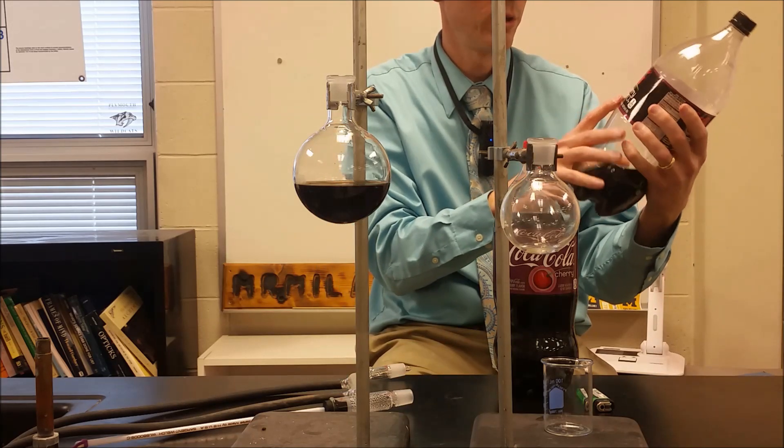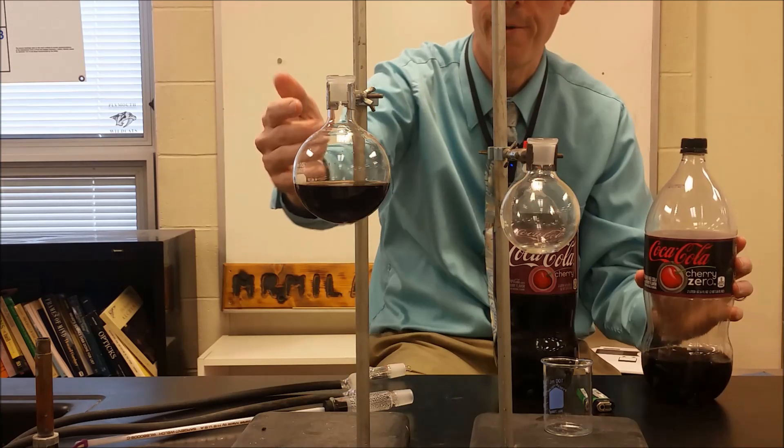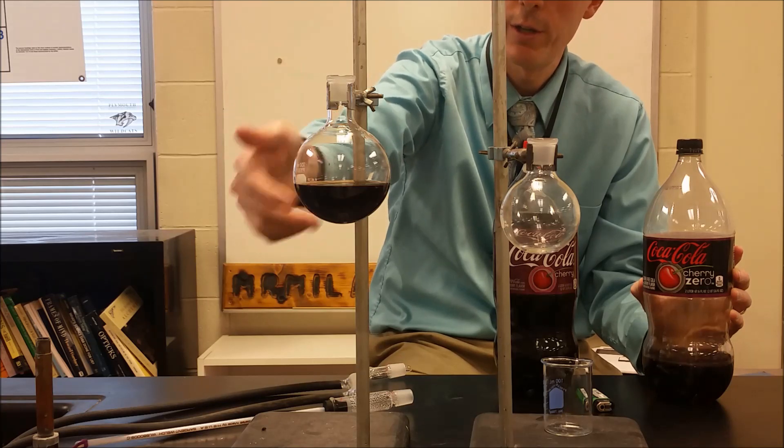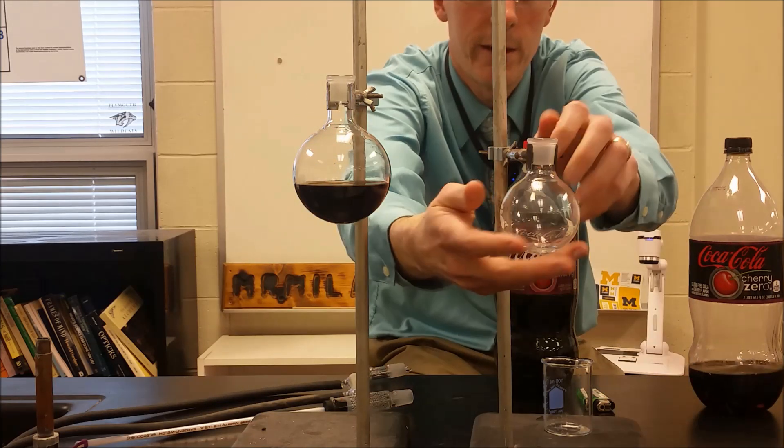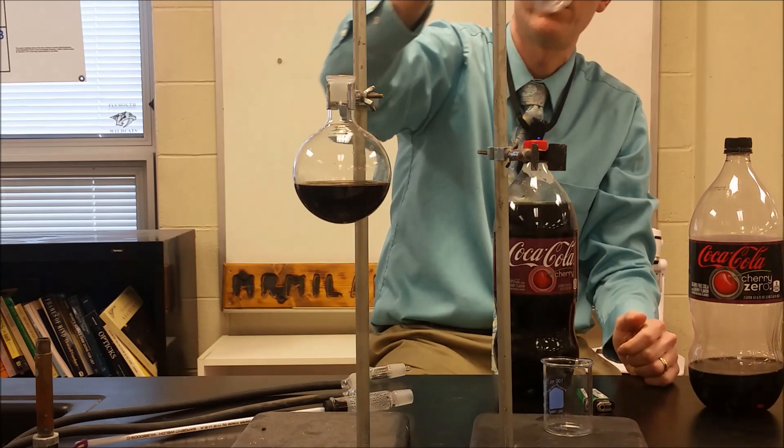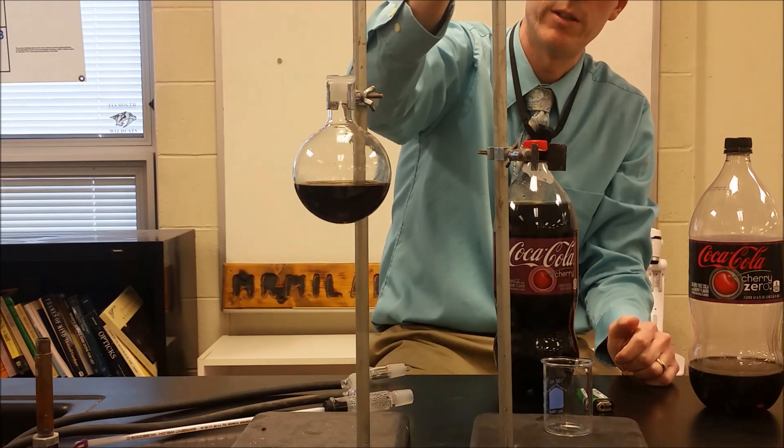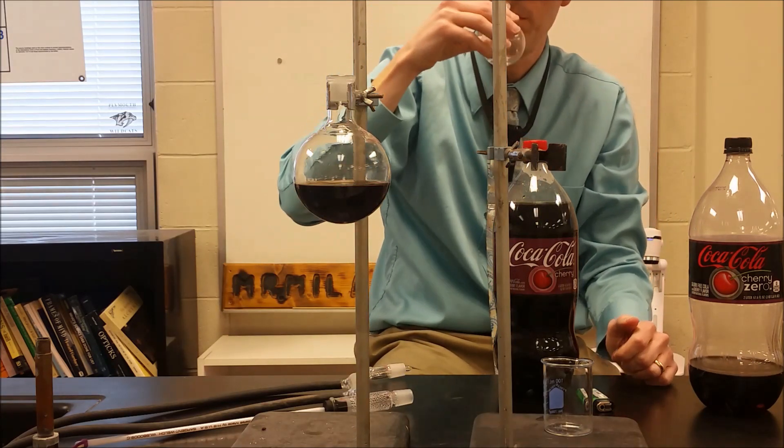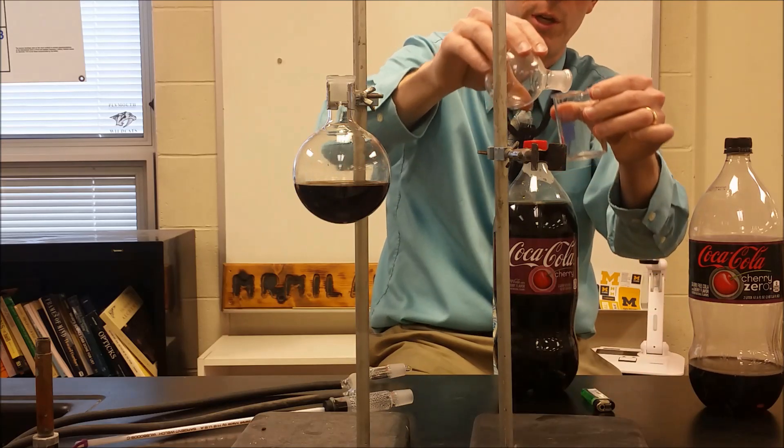So this is some Coca-Cola Cherry Zero which we've put into here and I've already done some distillation on it. The distillation resulted in a little bit of clear and colorless solution moving over to here that gives off the aroma of cherry.